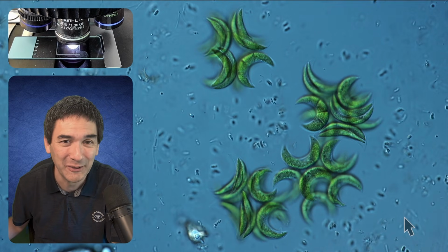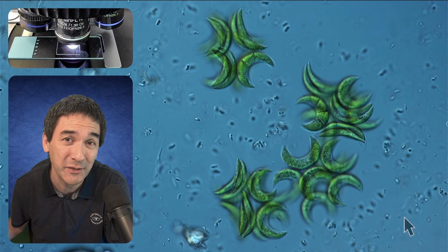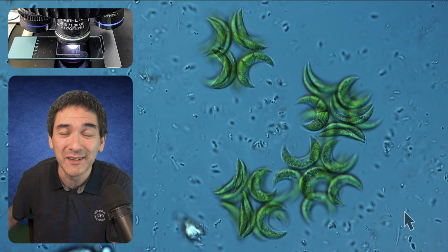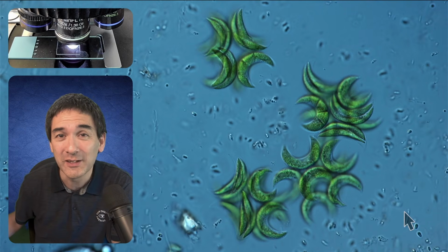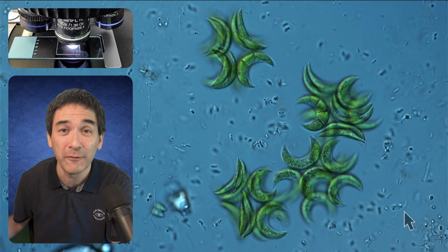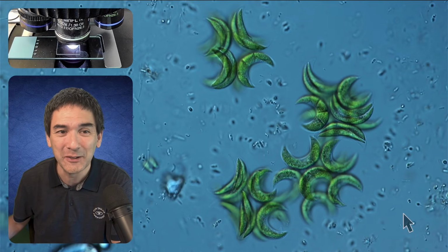Microbehunter here. I'm Oliver, and today I would like to show you what I consider an interesting phenomenon, one that has already been discovered back in the 19th century, and it's called the formation of aerotactic bands. And I know it sounds very fancy, so that's why I decided to show this to you directly here.